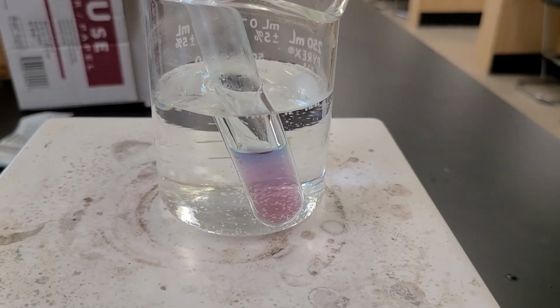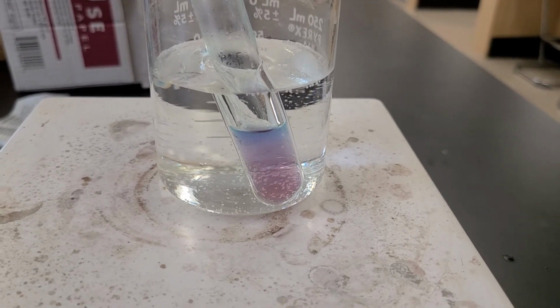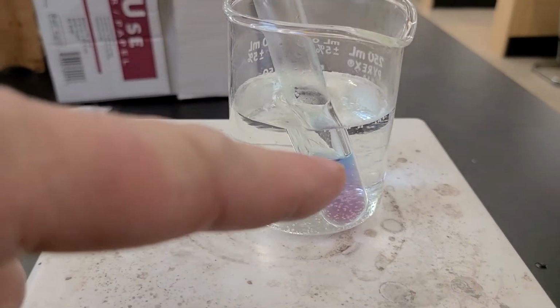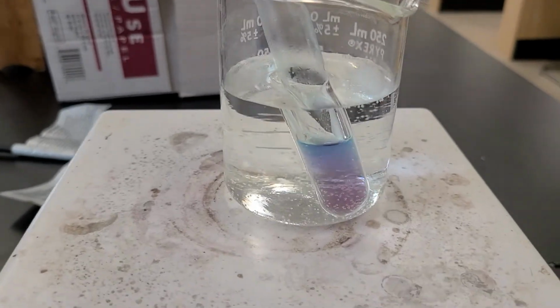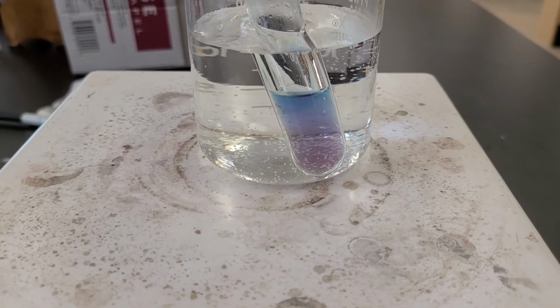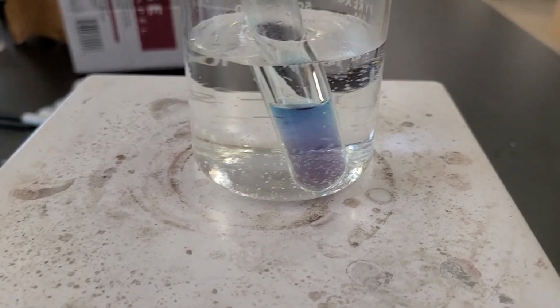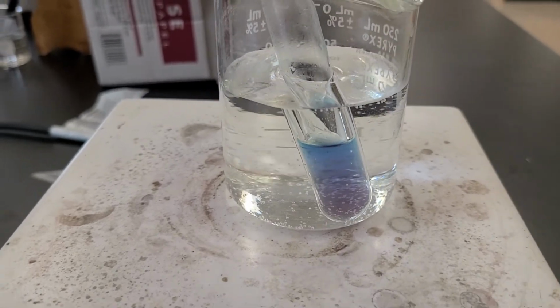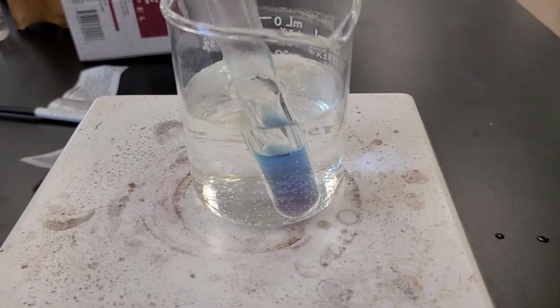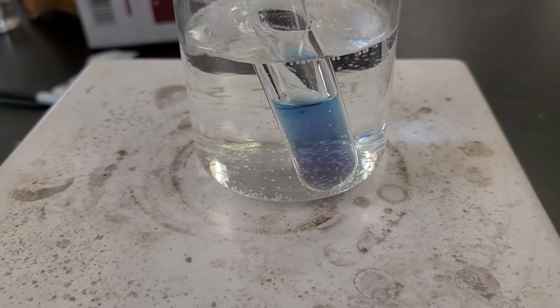Look at that top part. I'll make it so we have a white background here, the top of this somewhat stained heater. Look at the top right there, look what's going on. Isn't that interesting? And of course after this, I could put it back in the ice water and it would change back to that other color. I could do this all day long if I wanted to.